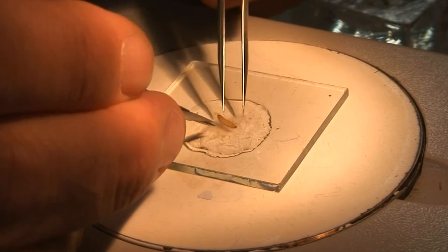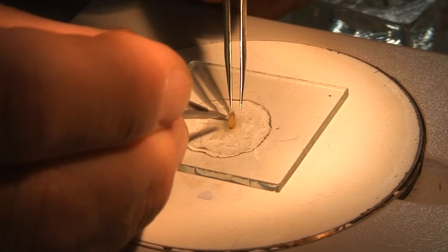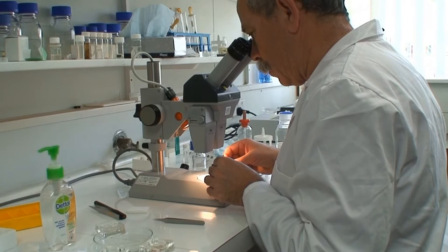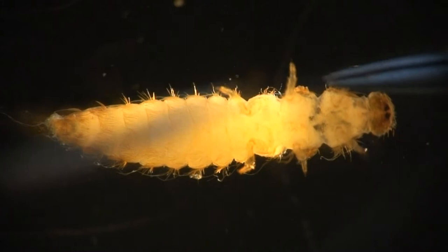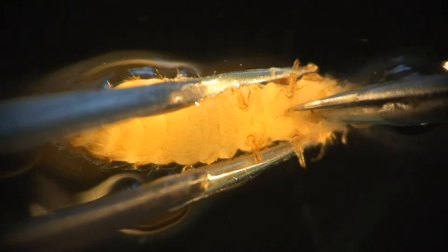Alternatively, the larvae can be placed into alcoholic hand-wash gel on a microscope slide or other flat glass surface, ventral side up. The gel works well at keeping the specimen moist and reasonably steady. All these steps can be done under a simple stereomicroscope. As shown previously, the specimen is then cut through the midline of the ventral surface to the last abdominal segment. The soft body wall of the larvae should cut through easily with sharp, quality scissors.